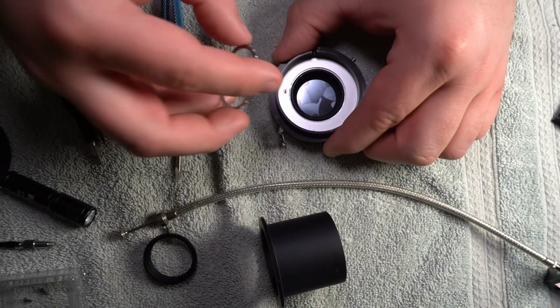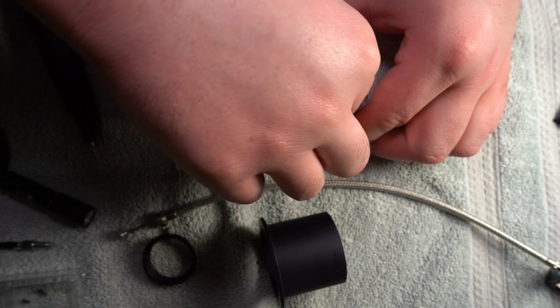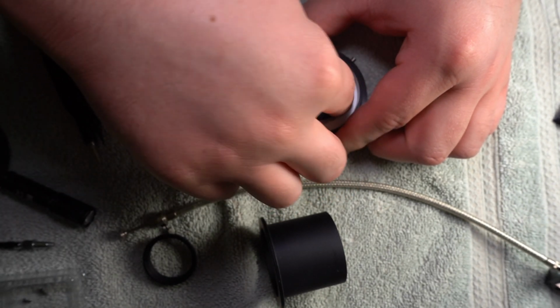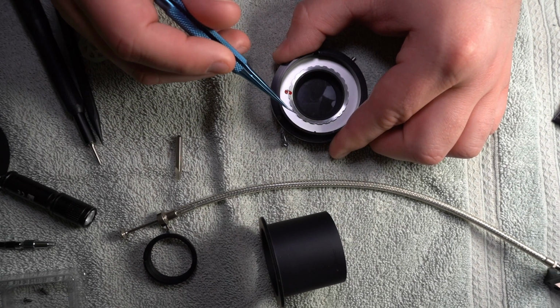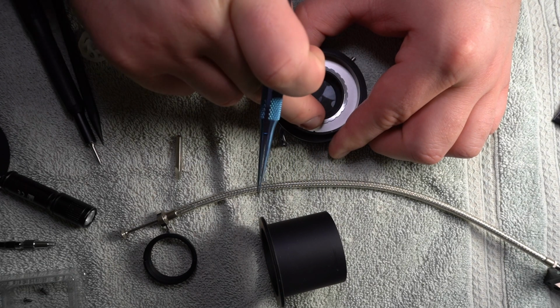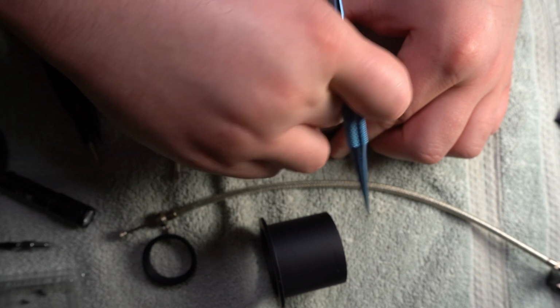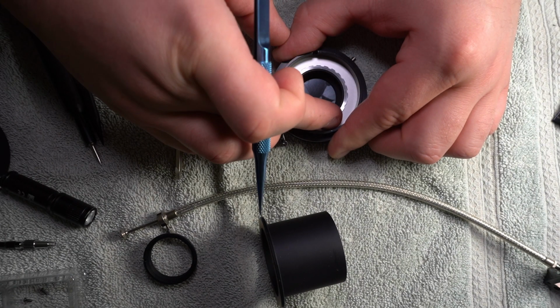And now that I've shown you that, I'm going to put this back together. Well, I still remember how, because that would be really bad if I didn't know how to do this. So this gear is very interesting, or it's not a gear, it's a nut, I think. It's kind of like a castle nut. Yeah, you know what? I like that. I like their theory there.